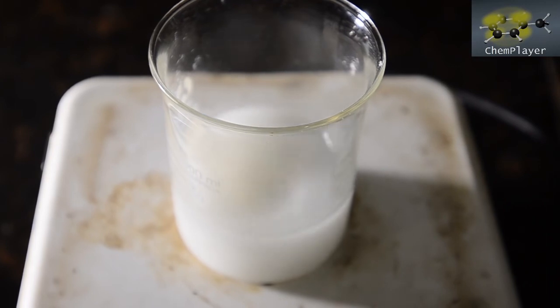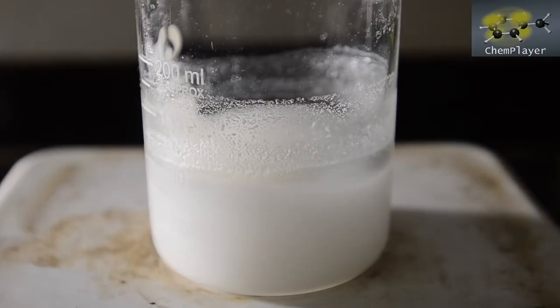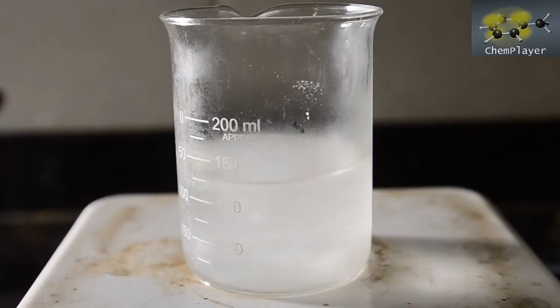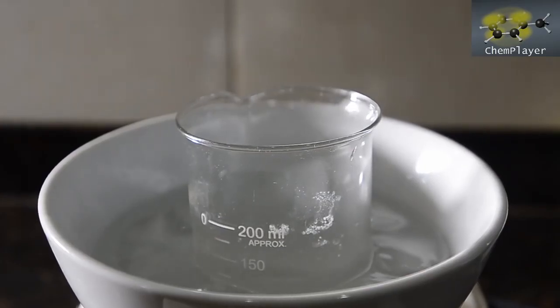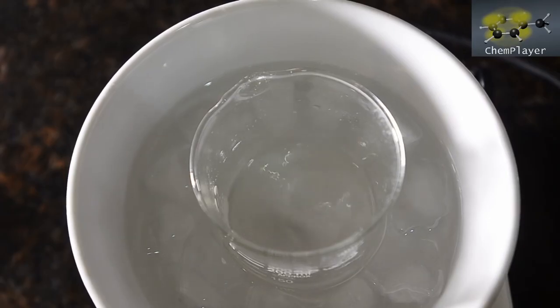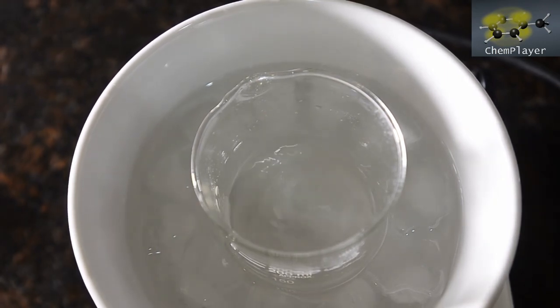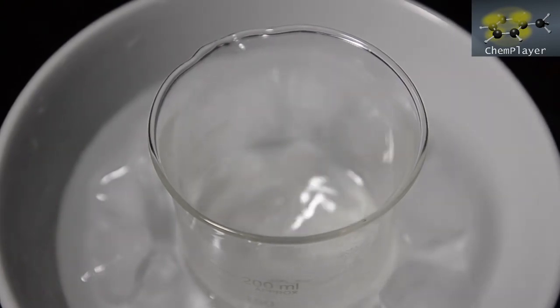As the vanillin dissolves it cools the mixture quite strongly, making it less soluble. We want the mixture cool though, so we need to add enough DCM so we've got a chilled solution — about 130 ml of total volume, and nearly all dissolved. So now we get this set up in a cooling bath of ice and water. The nitration will be exothermic, and although DCM boils at 40°C we don't want it boiling everywhere. This is now happily chilled down.